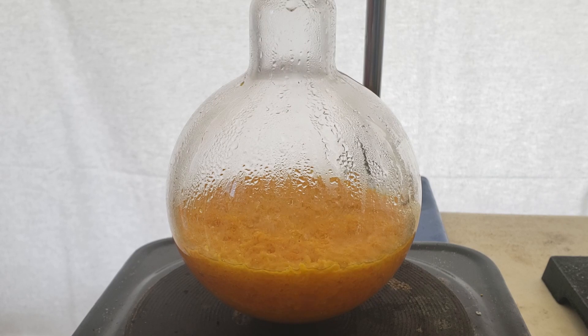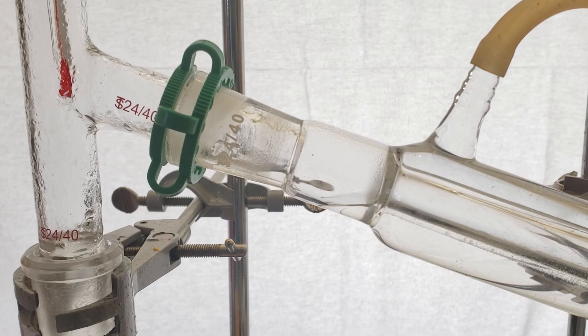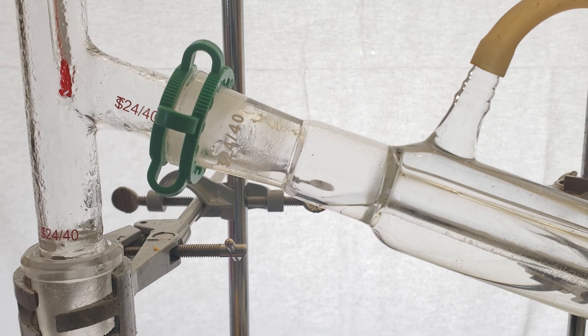After a while, the soupy mixture began to boil. I began to see some liquid forming in the stillhead, and the temperature of the thermometer also rose considerably.